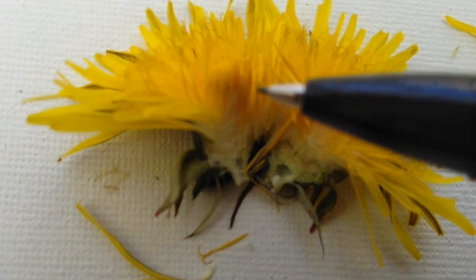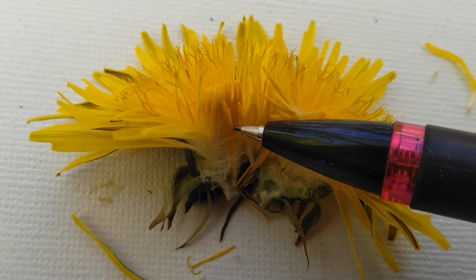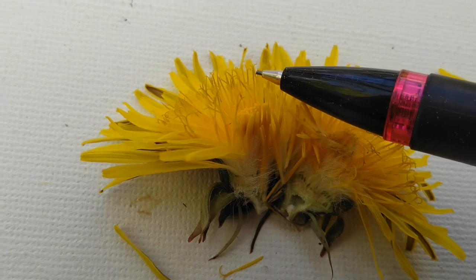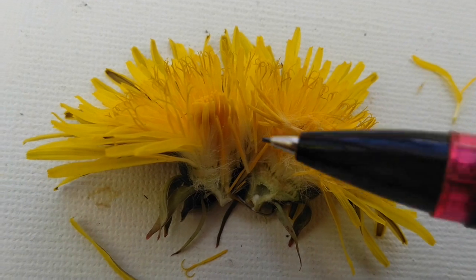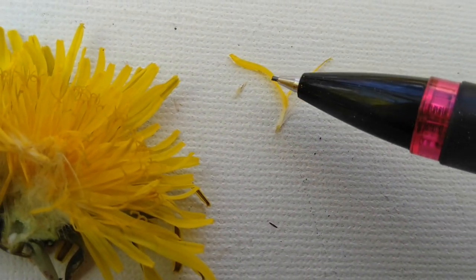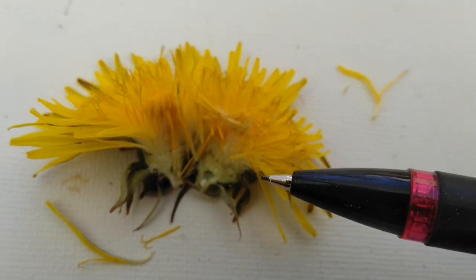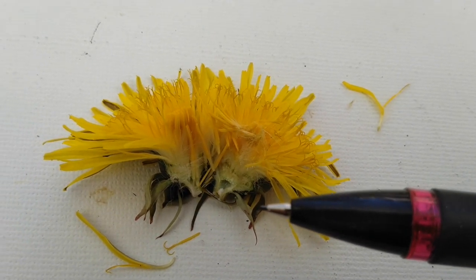In the middle, right in here, these short parts, those right here, that's the stamen, and that's where the pollen comes from. It's in the middle of all of those pistils. These are all pistils, these taller ones that have like the split ends. And each of the pistils has a weird little petal attached to it to attract a bee. But it makes sense when you think about it that these are a bunch of different little flowers, because remember, what does a dandelion look like after the petals are gone and it's made seeds?